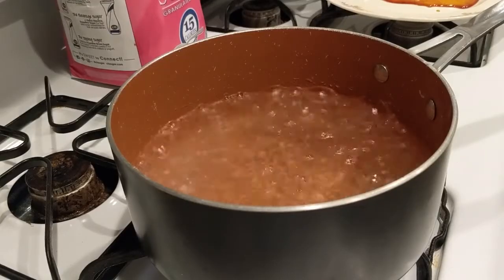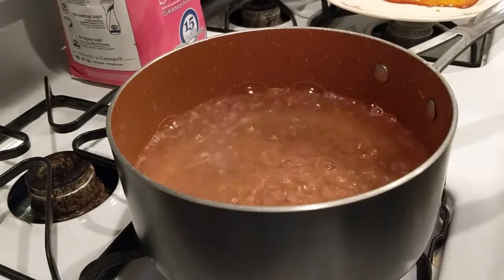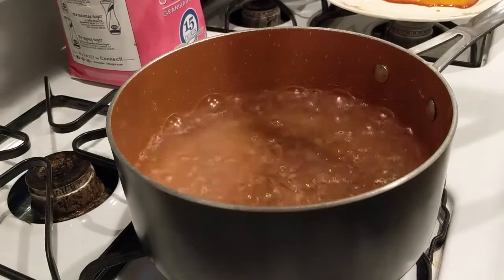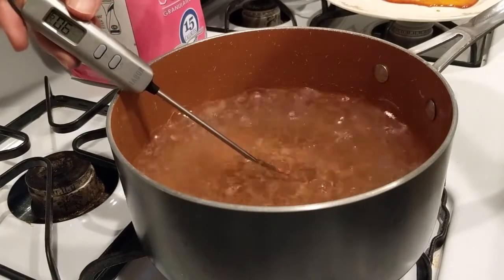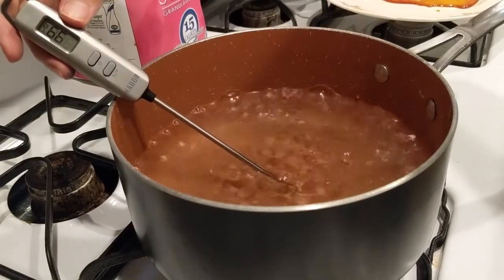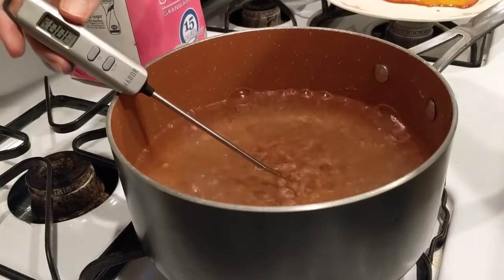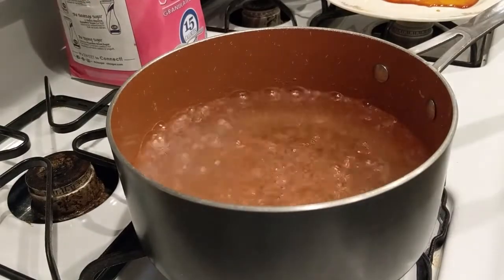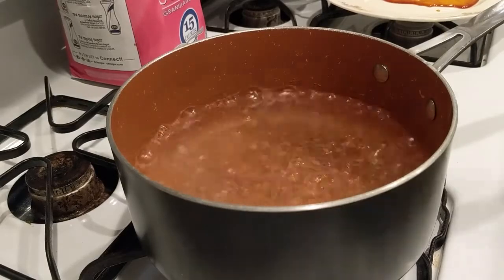All right, we're at a full boil now. Let's take a reading on our thermometer. Go to Celsius here. Leave that in there. Looks like we're at 99... Wow, accurate thermometer. Look at that. 100.2. 100.0. All right, right on. That's exactly what we would expect with water. So this is the most accurate thermometer I think I've ever used for this.